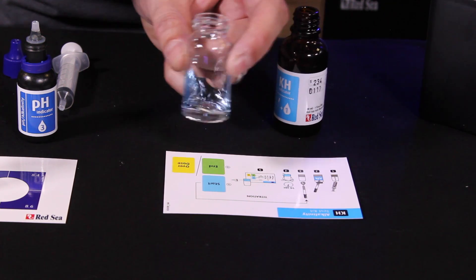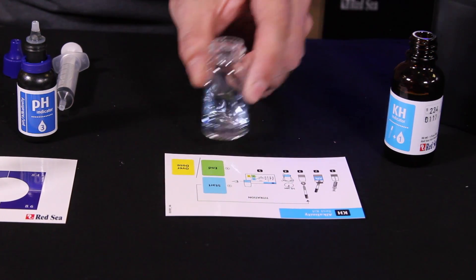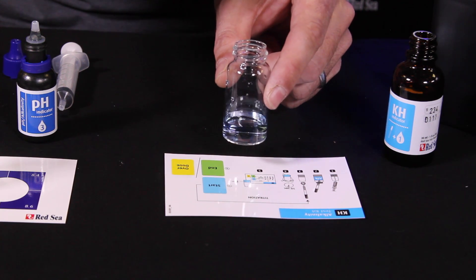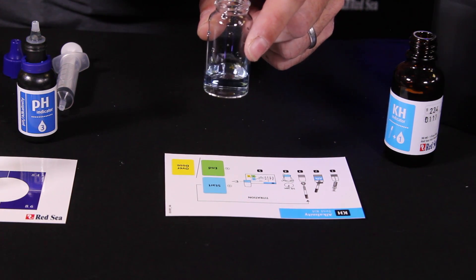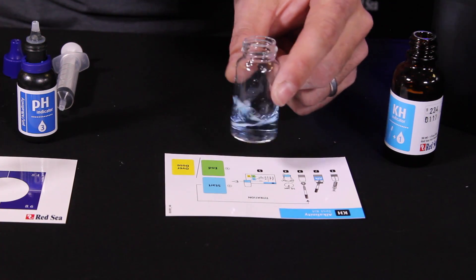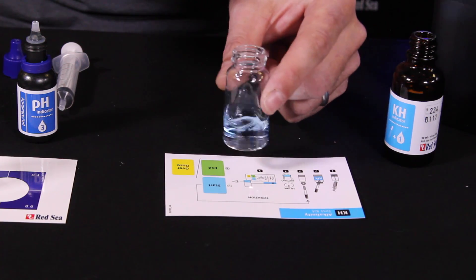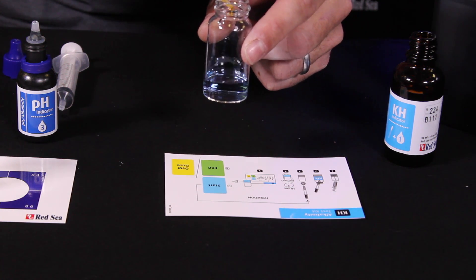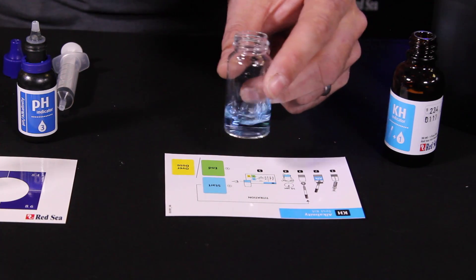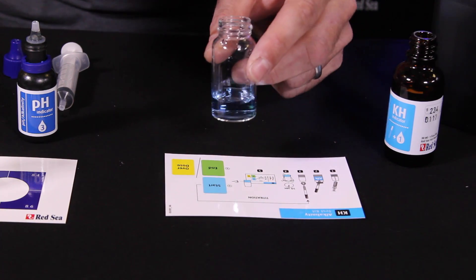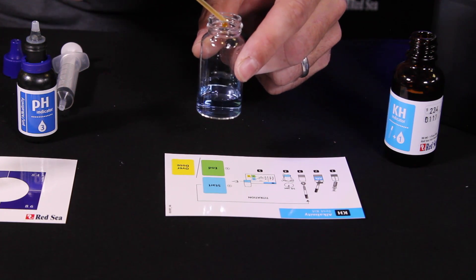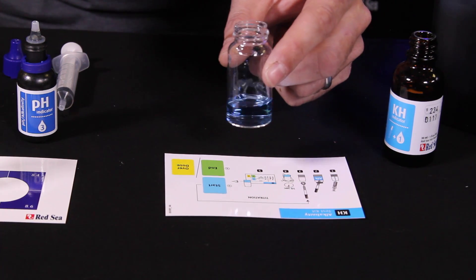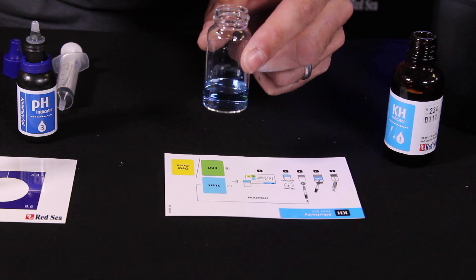Second drop. Move this out of the way here. I see a very slight blue hue. Third drop. Definitely see a blue hue now. Fourth drop coming up. Still blue. Fifth drop. Still blue. Waiting for that color to change to green.